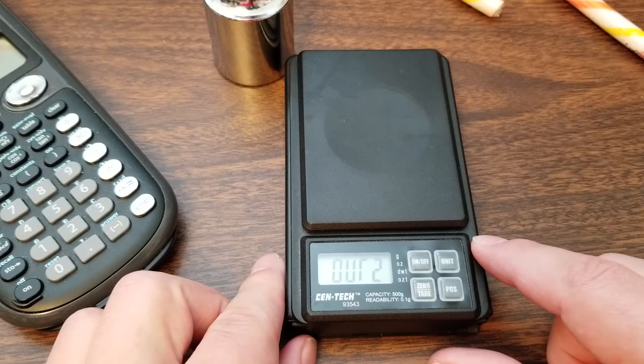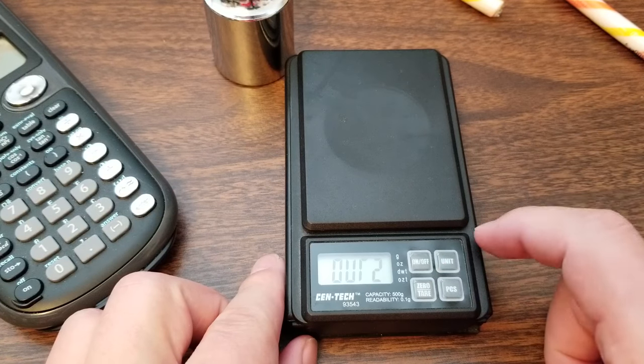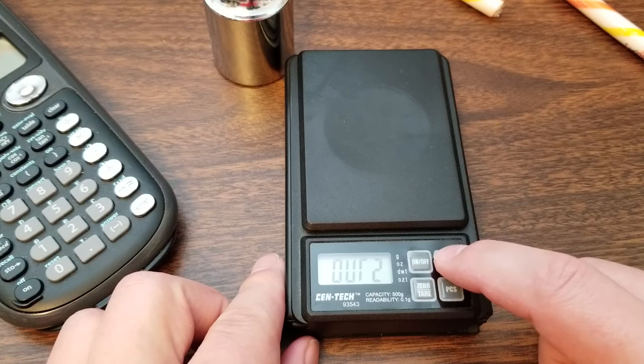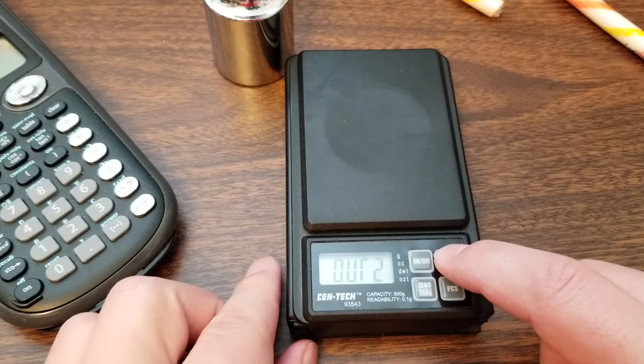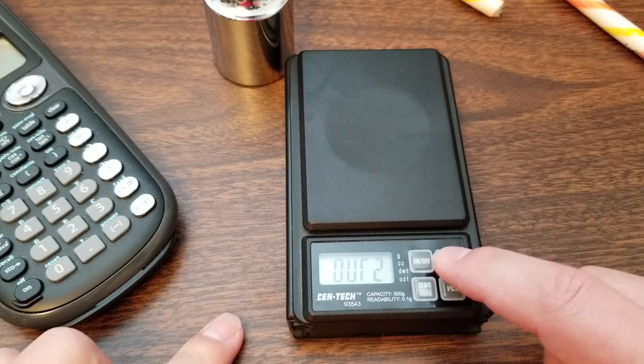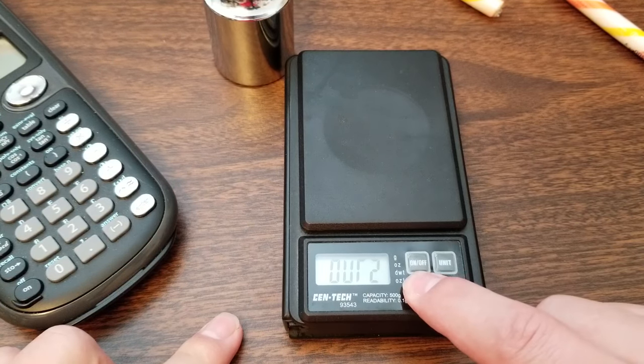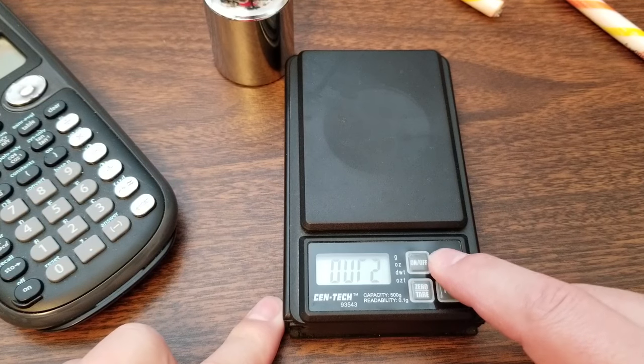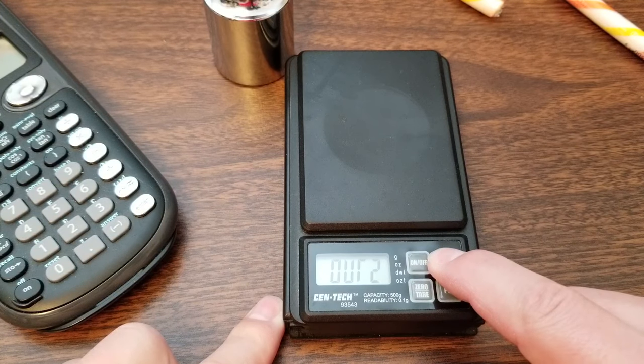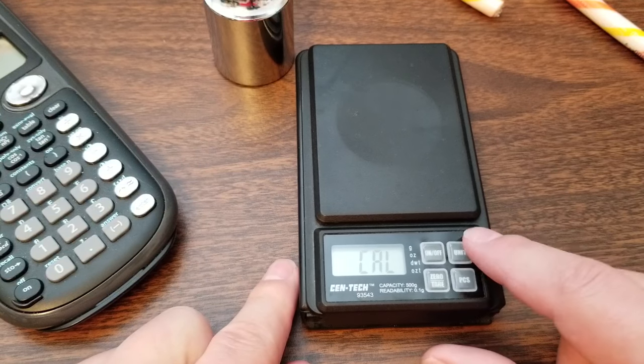So the process, according to the instructions on the inside cover, is to hit the unit. I believe it was unit. It will hold unit. All right. There we go. Cal.